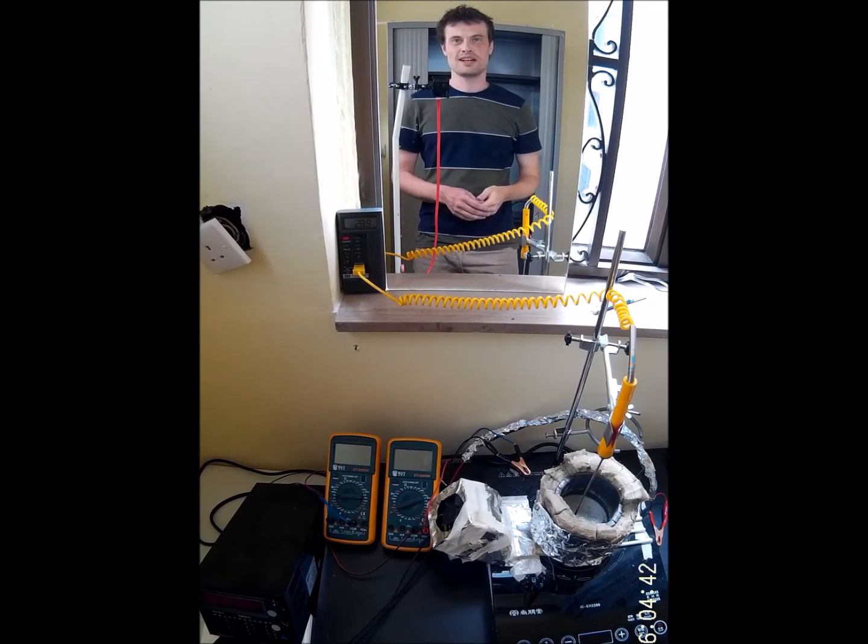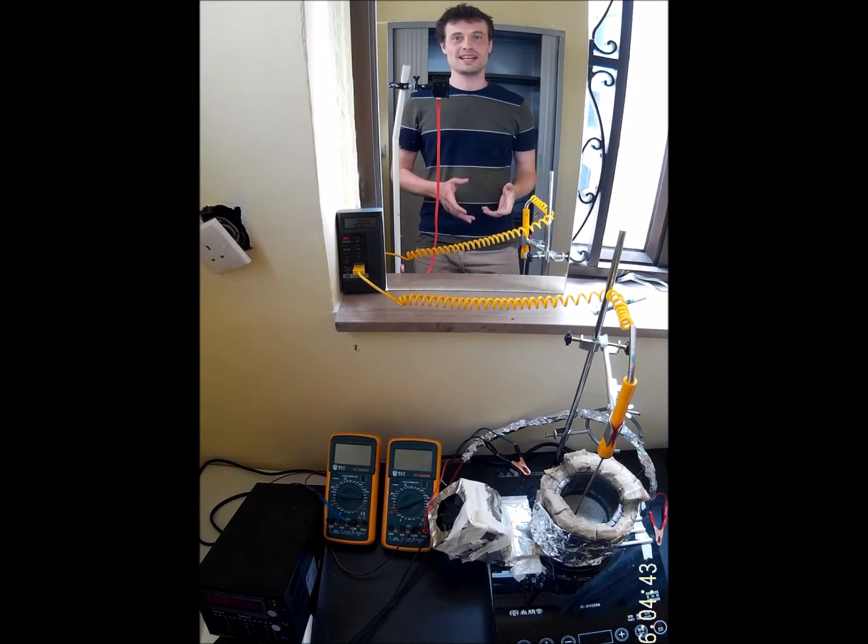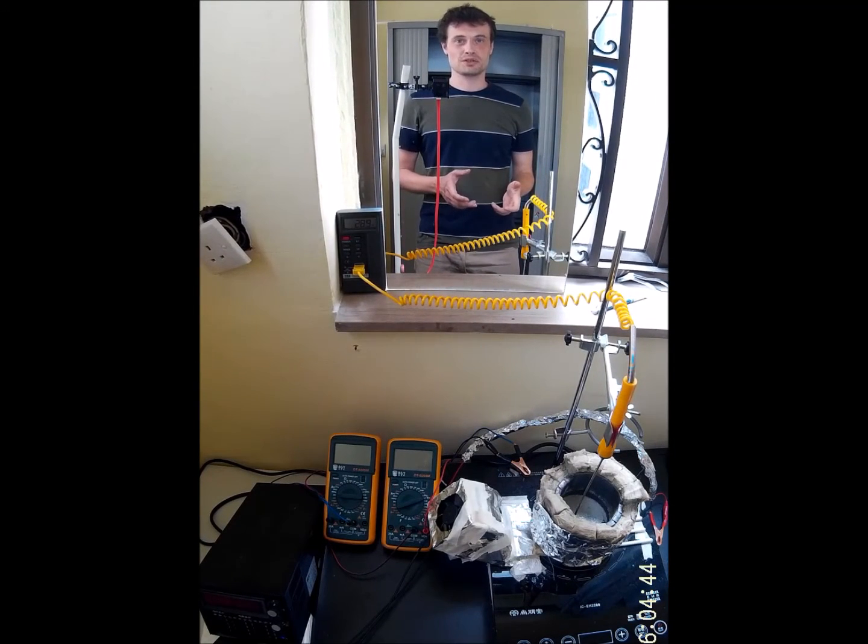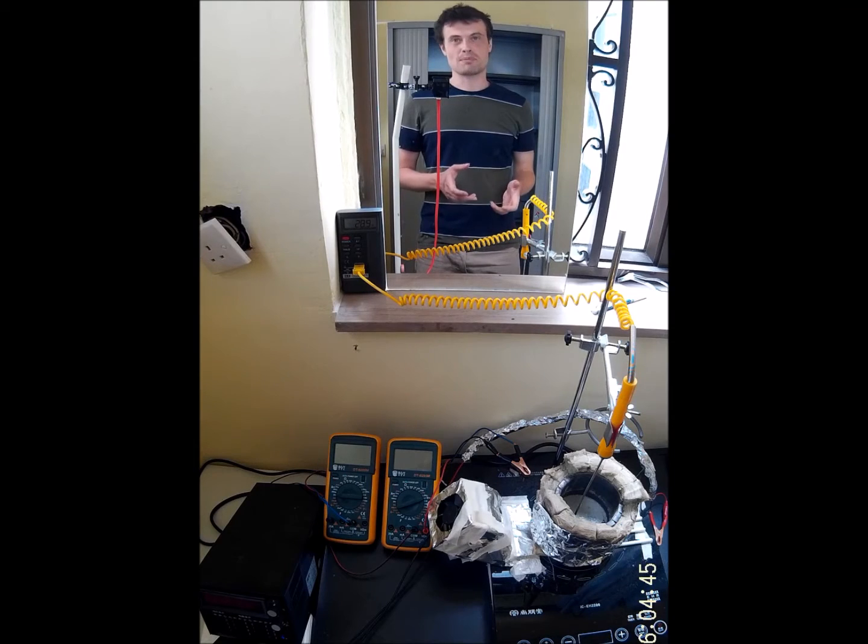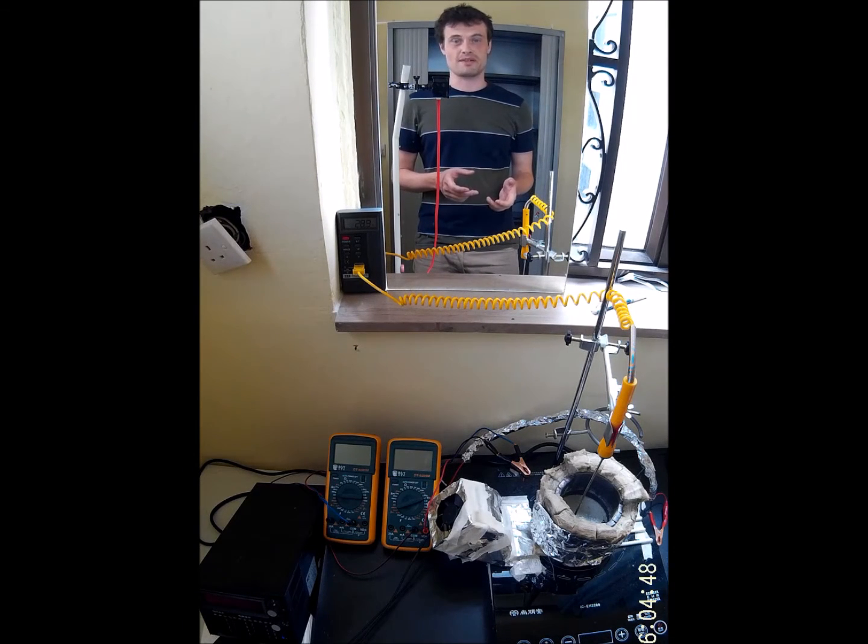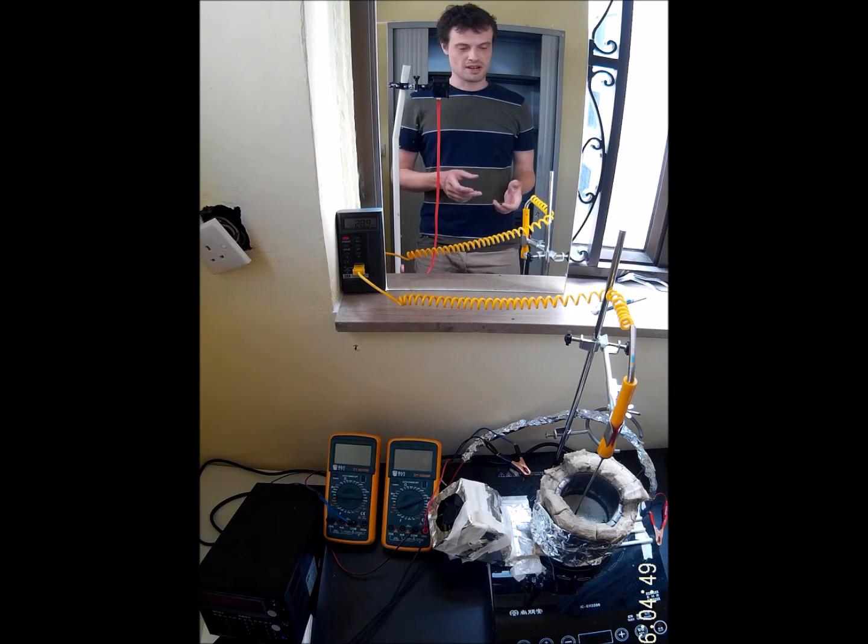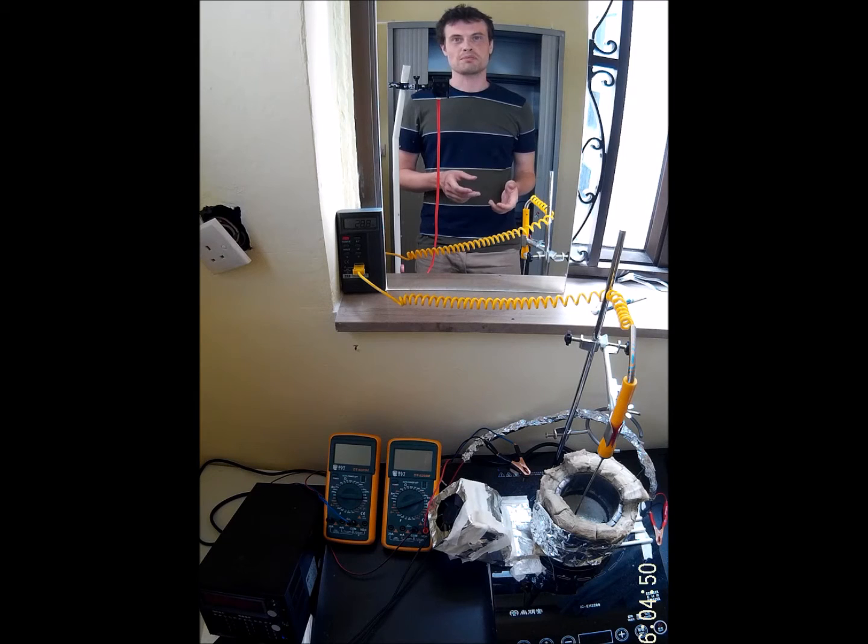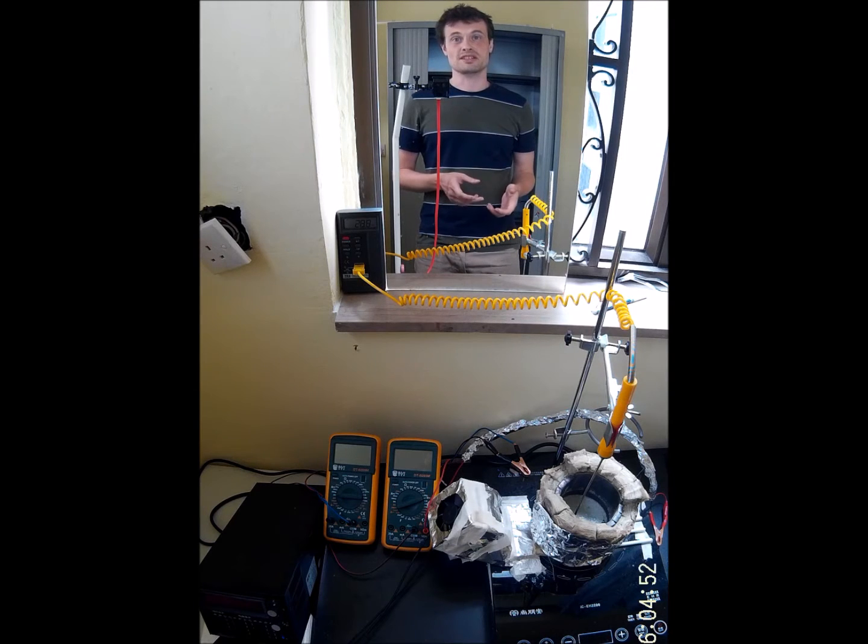Hello viewers! Today I will try to cook up some carbon nanofibers out of thin air. This is supposedly possible using electrolysis.